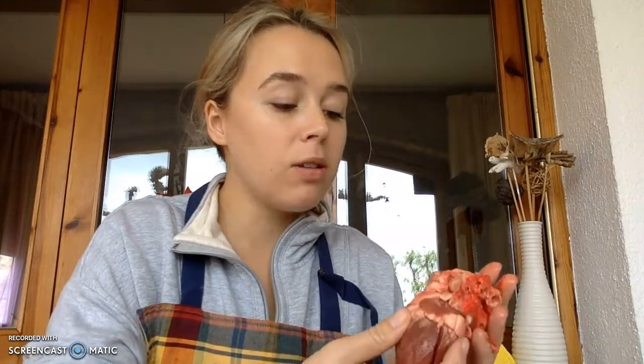And today we are dissecting a sheep heart. Well, I've already dissected it, but I'm actually kind of excited about this one. I was most nervous about this one, and then I was really excited. I have a fresh sheep heart, but mine still includes a lot of the aortic valve and the aortic arch. You can still see the three aortic branches that branch off of the aortic valve. Pretty cool. Anyways, let's get to identifying.